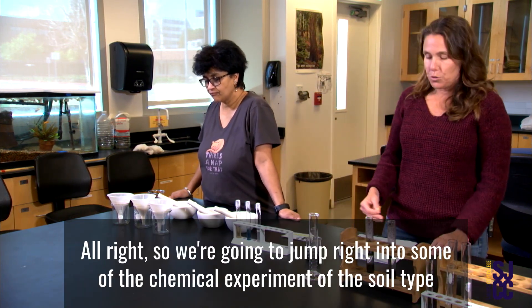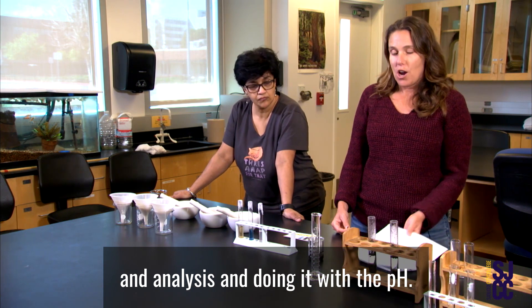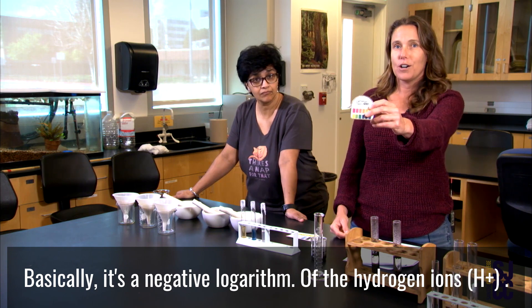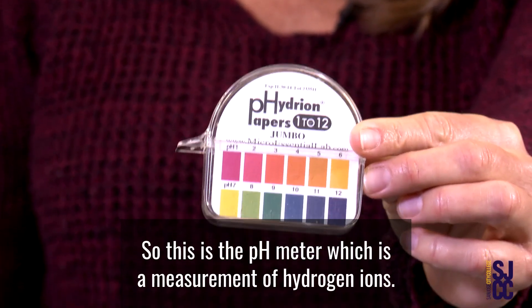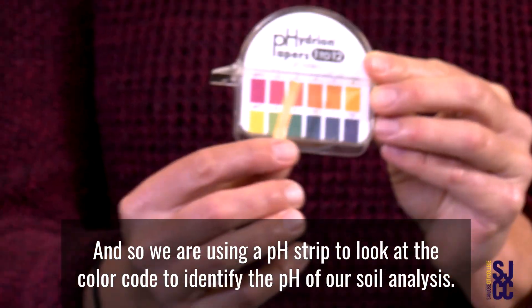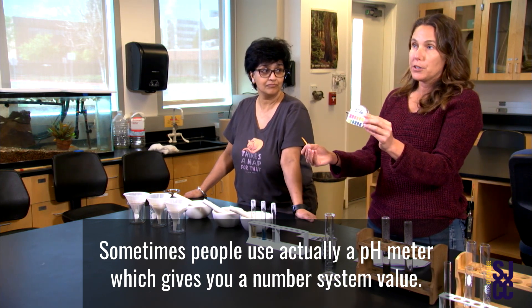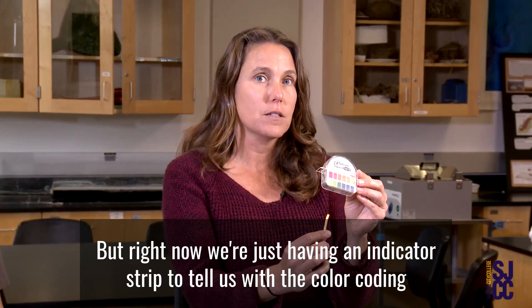We're going to jump right into the chemical experiment of soil type analysis, starting with pH. We have a pH meter strip — the pH measures hydrogen ions. Basically it's the negative logarithm of the hydrogen ions. We are using a pH strip with a color code to identify the pH of our soil. Sometimes people use a pH meter which gives a numerical value, but right now we're using an indicator strip with color coding.